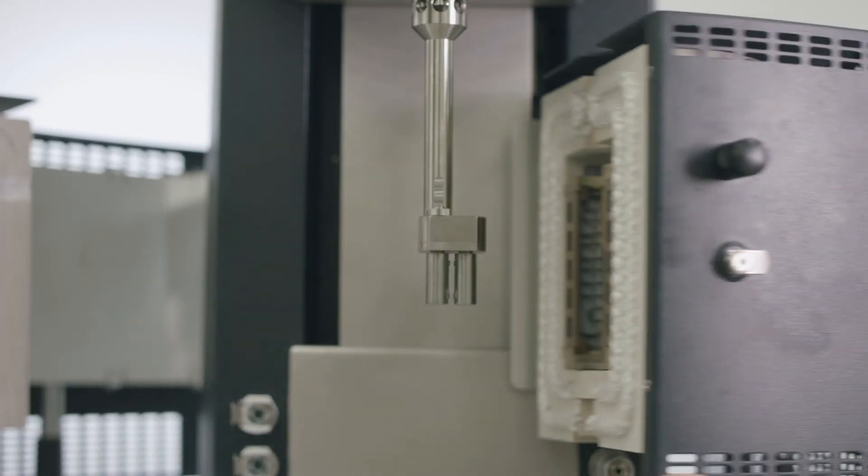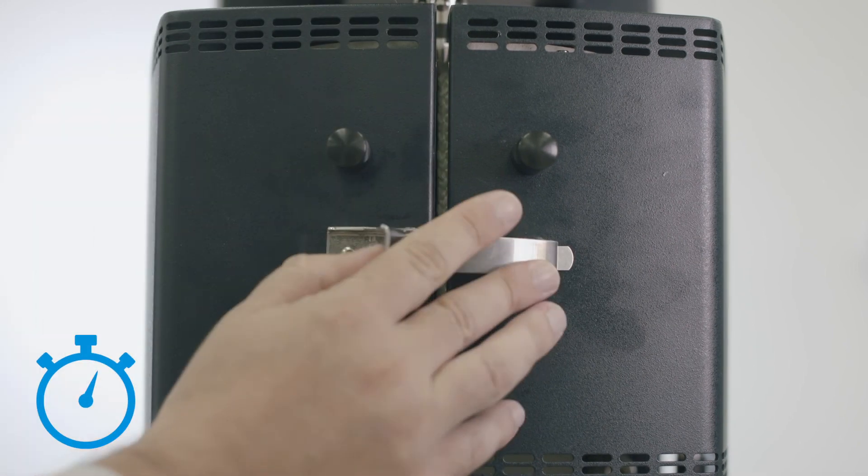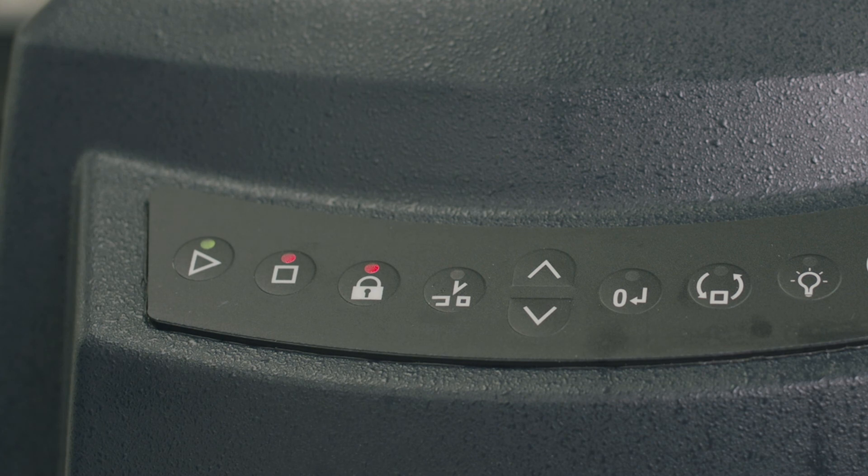Heat the oven and geometry to the desired test temperature and allow to soak for several minutes. It may be helpful to lock the motor prior to the next step.